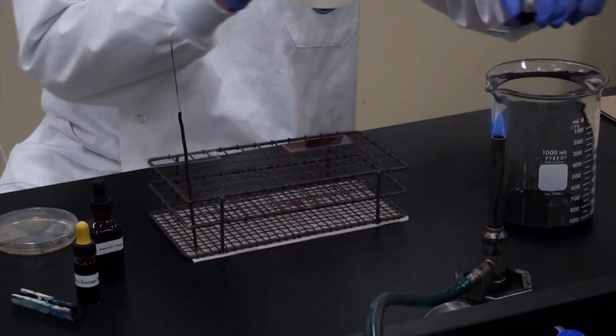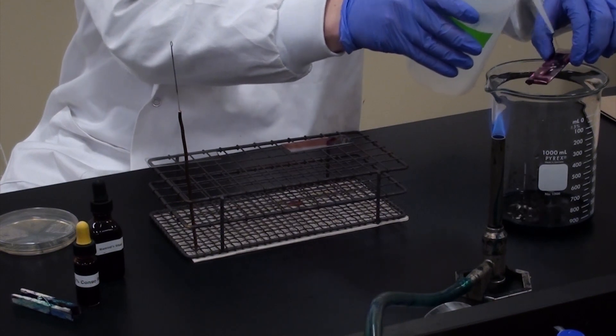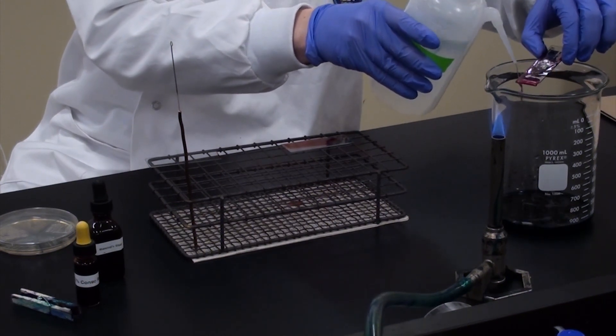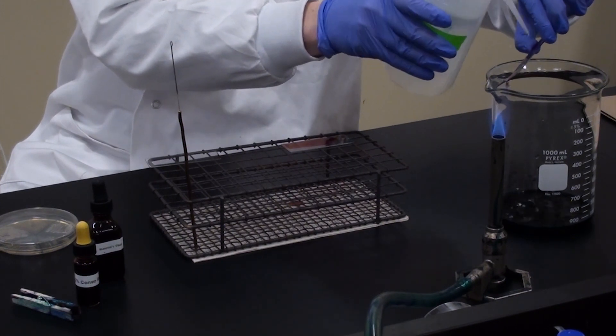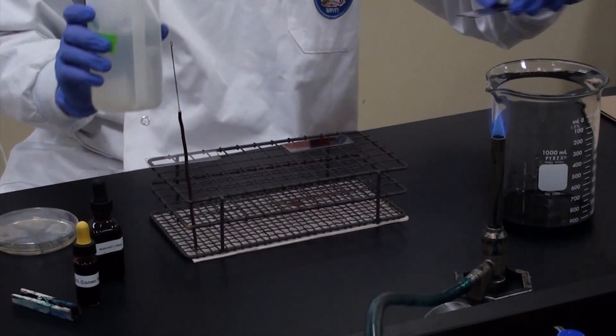Which you'll do. Just rinse it off. Gently of course. Because you did not heat fix these bacteria so you might wash them off. And now you are ready to visualize.